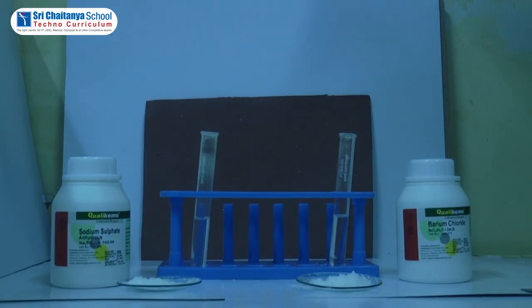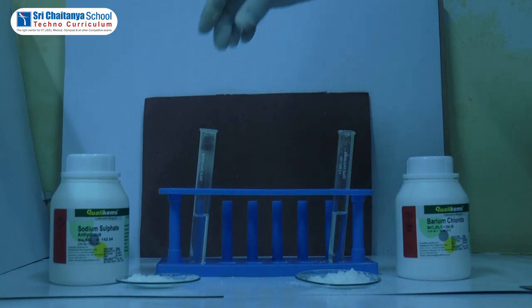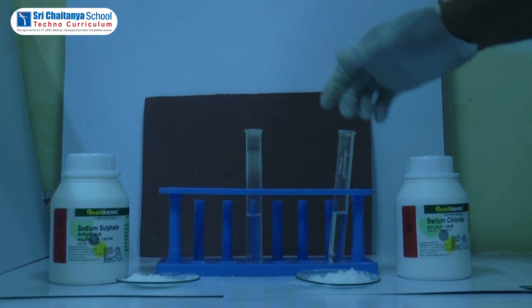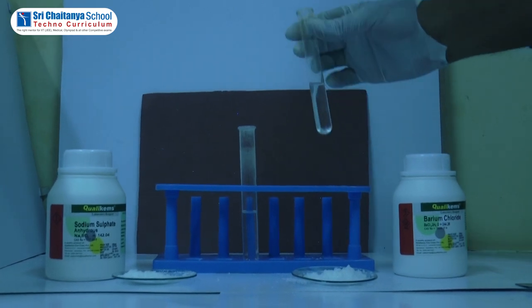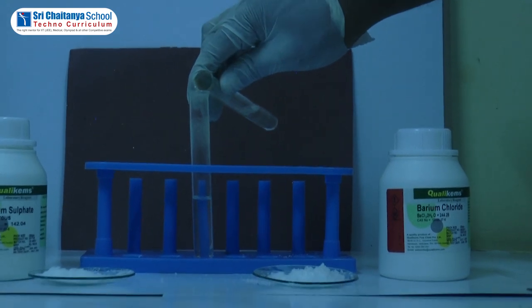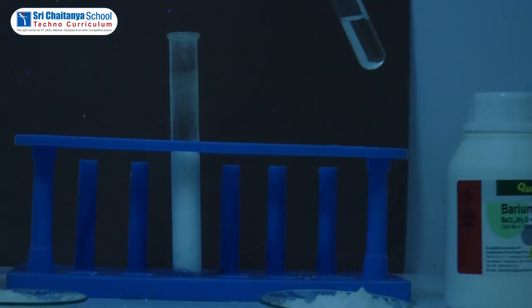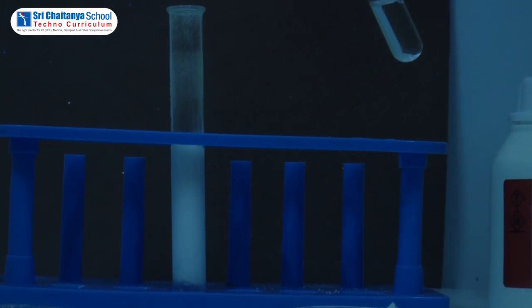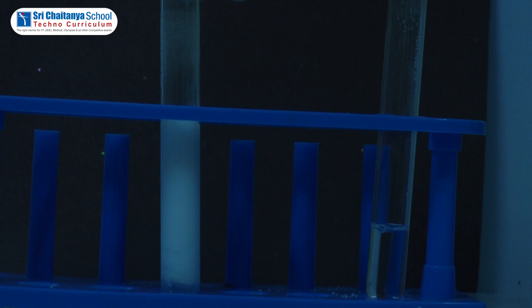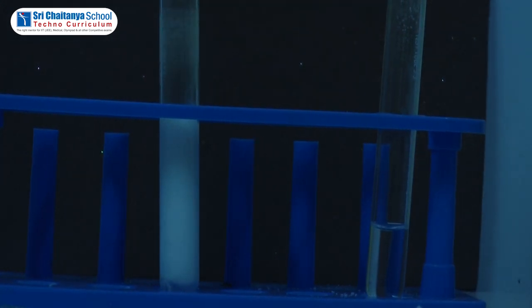Now, add the two solutions slowly together. So, what did you observe, my dear children? The observation is: a curdy white precipitate is formed.